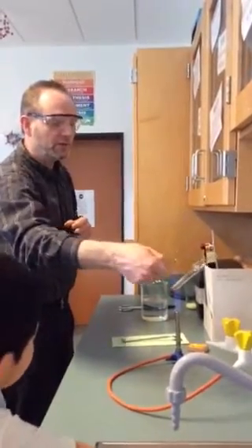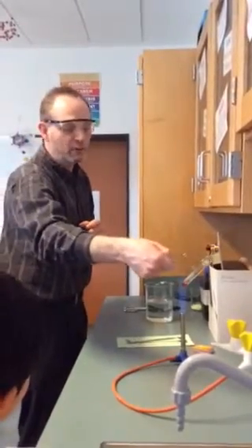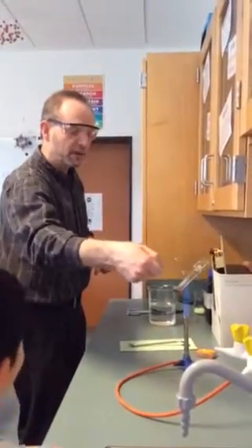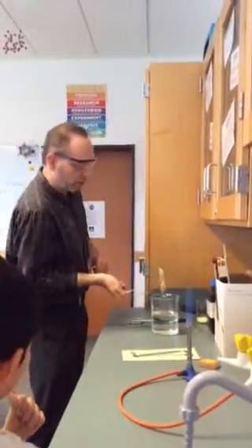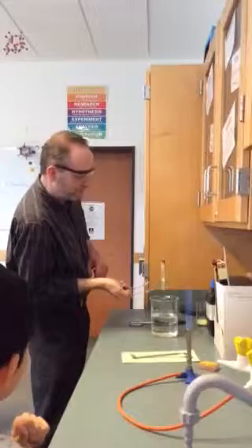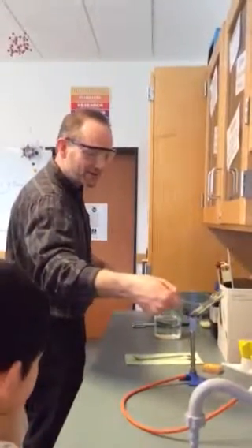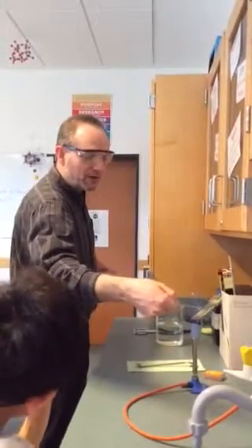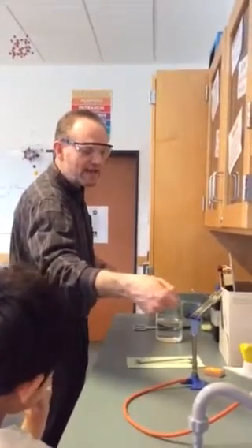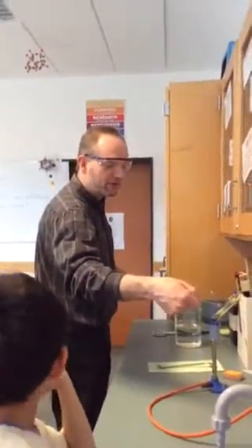Now I'm going to take this liquid sulfur, it's kind of a reddish liquid, and I'm going to dump it into this big beaker full of water. So in 1, 2, 3, oops, it solidified on me while I'm talking. So here we go. Now you might smell a little strange rotten eggy odor. That is a sulfur oxide gas.